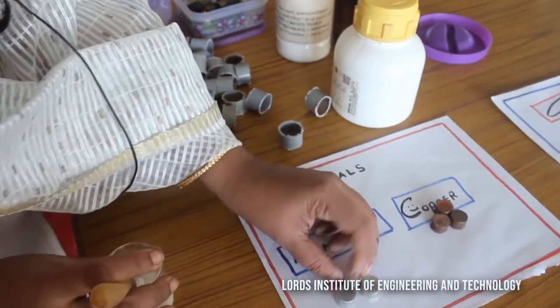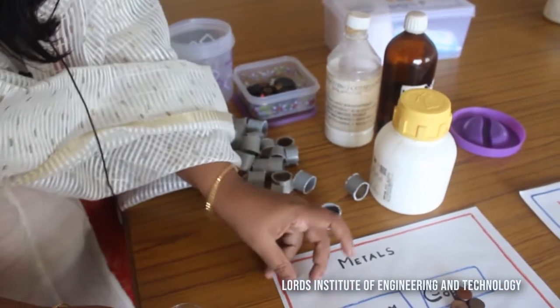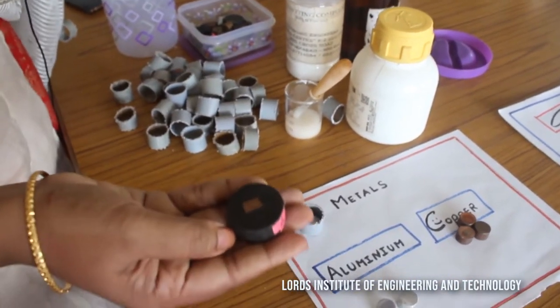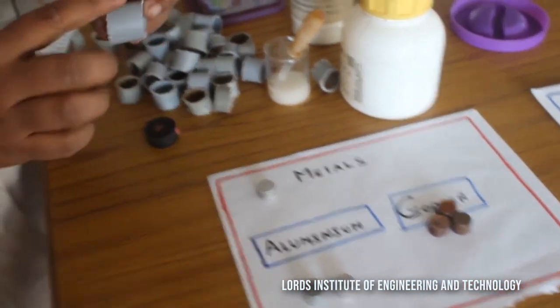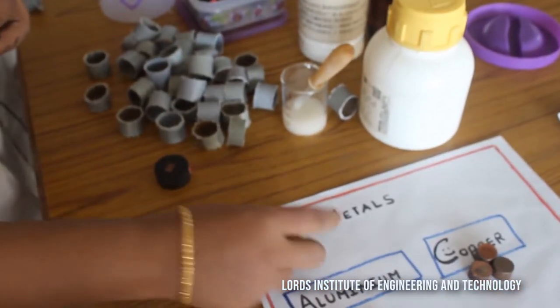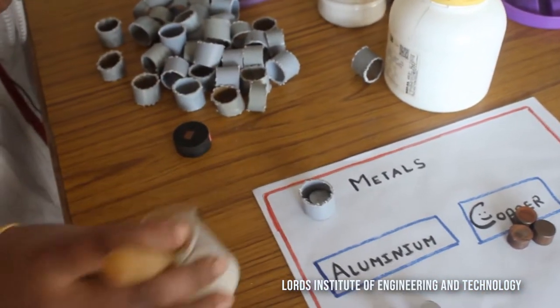First we are going for grinding, then for polishing. After grinding and polishing, we are going to pour the cold setting solution into the PVC pipe and it will solidify. Since it is a black color material it appears black inside the pipe. After this we remove the PVC pipe and the final specimen appearance is obtained — ready for further grinding and polishing.